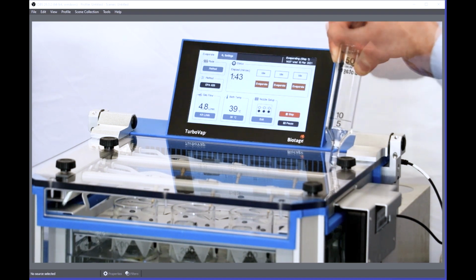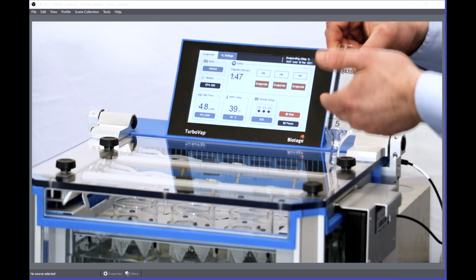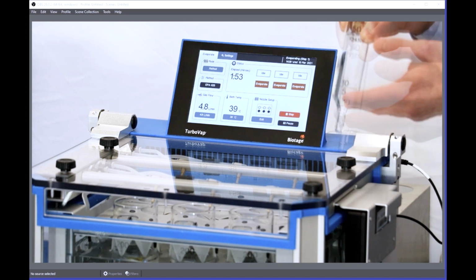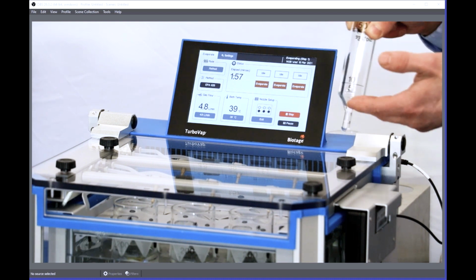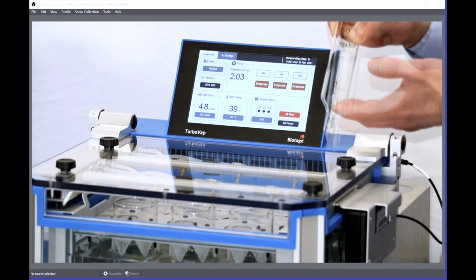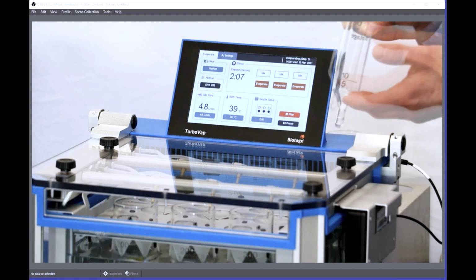As you ramp up the nitrogen, it will actually start to catch up to the tubes that are filled with less solvent, and they all can finish at the same time if you optimize the procedure, and therefore you don't necessarily need to use endpoint sensing, and you can move into the LV system, which actually allows you to store 24 50 mil tubes for concentration.